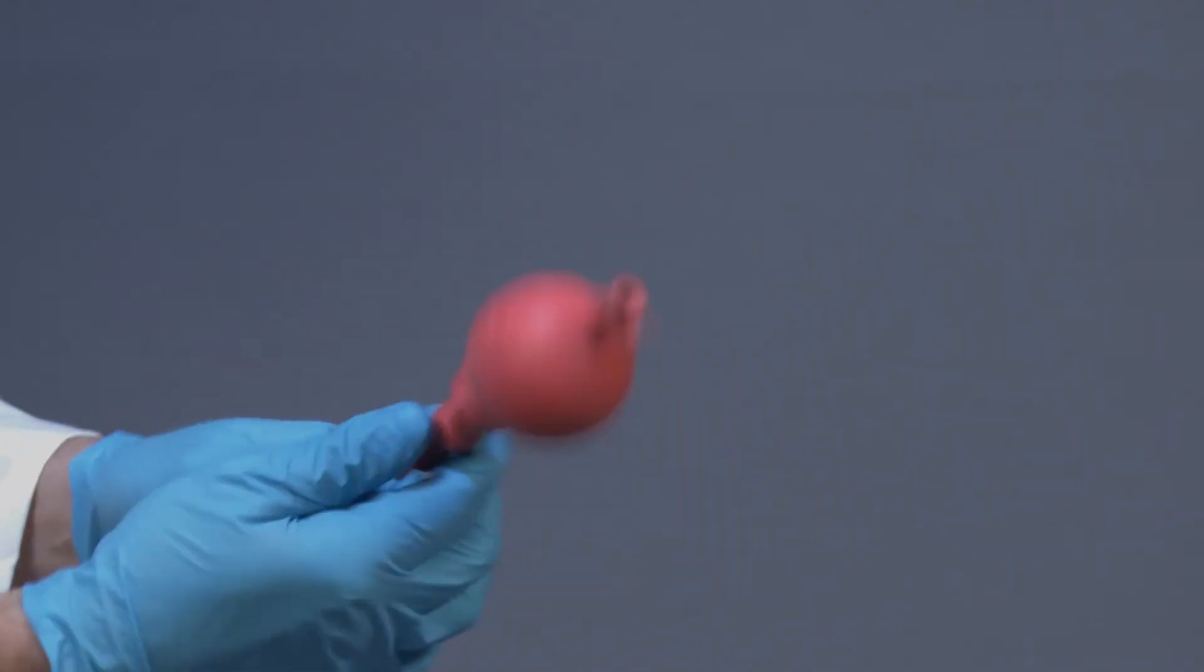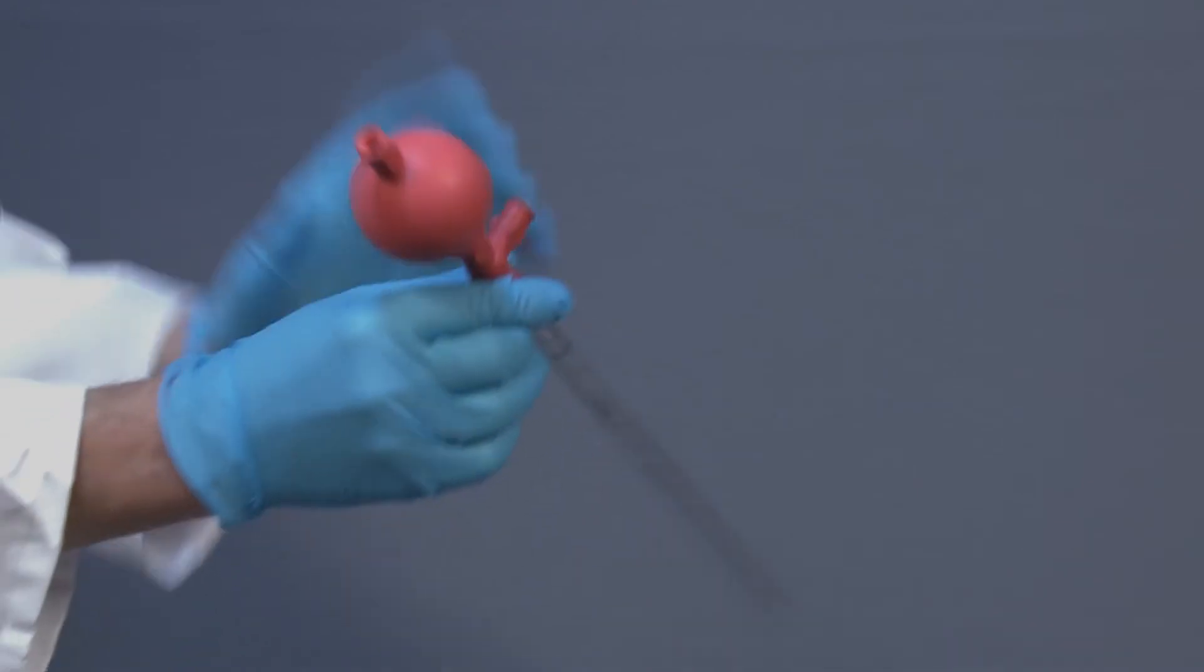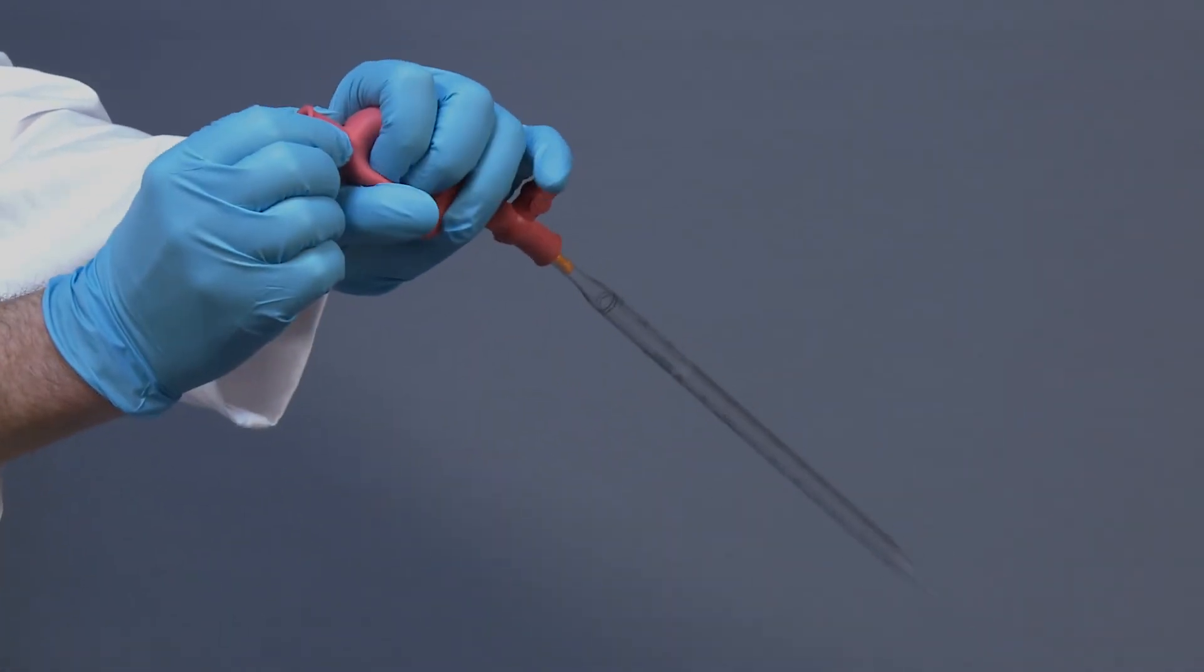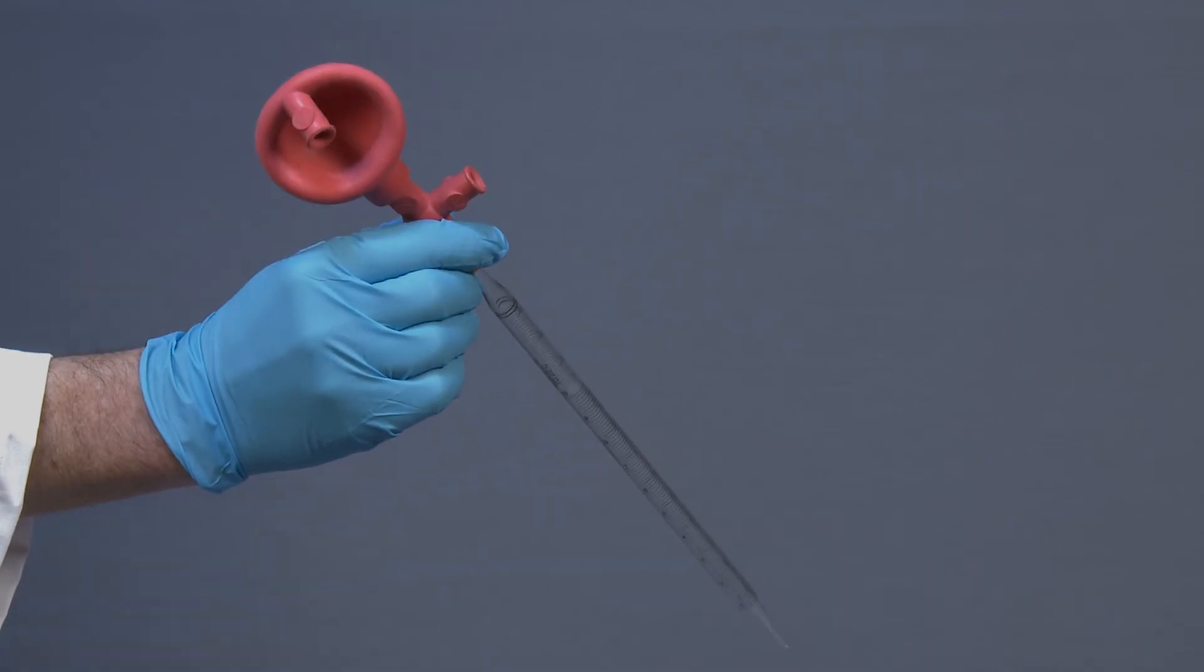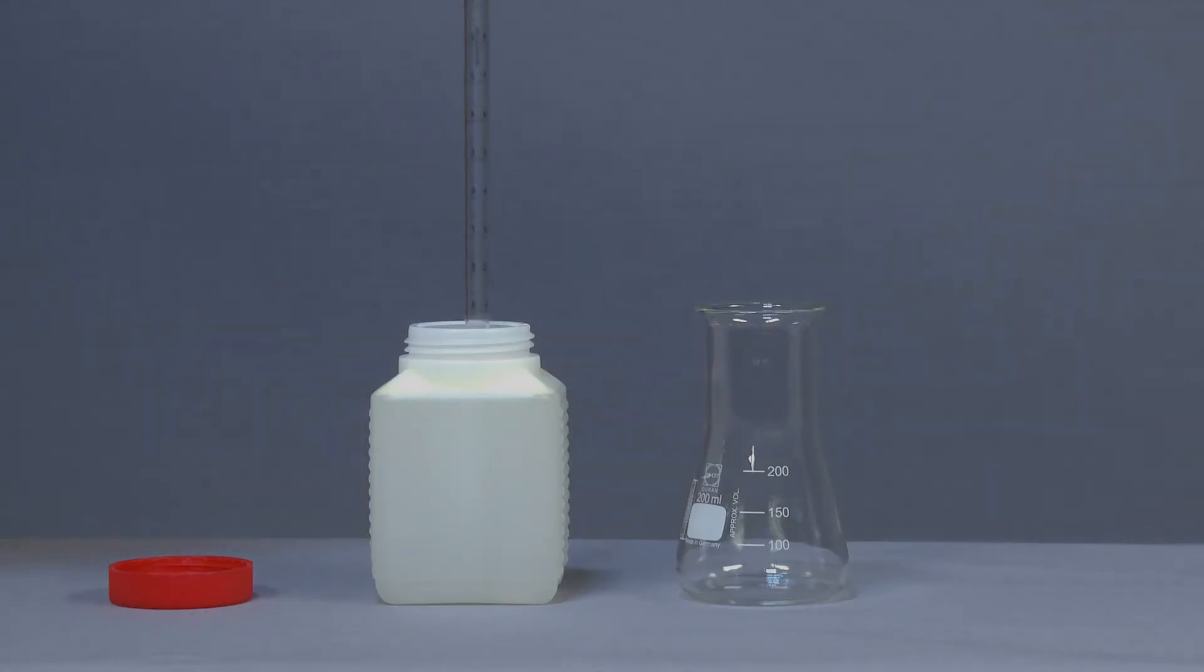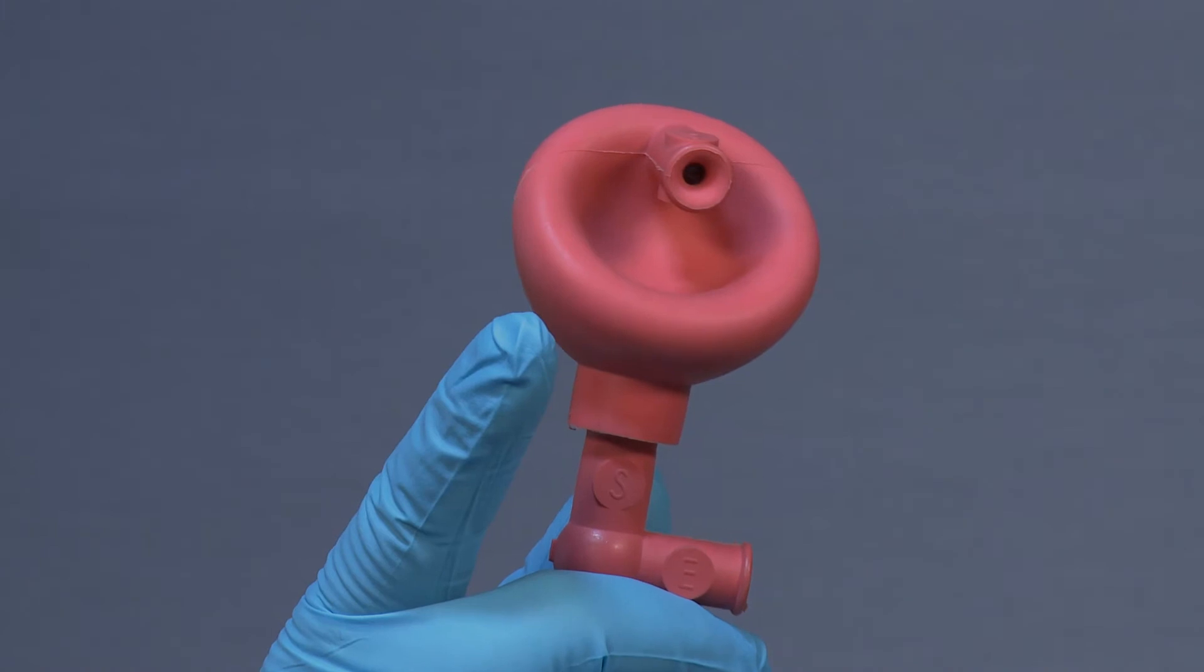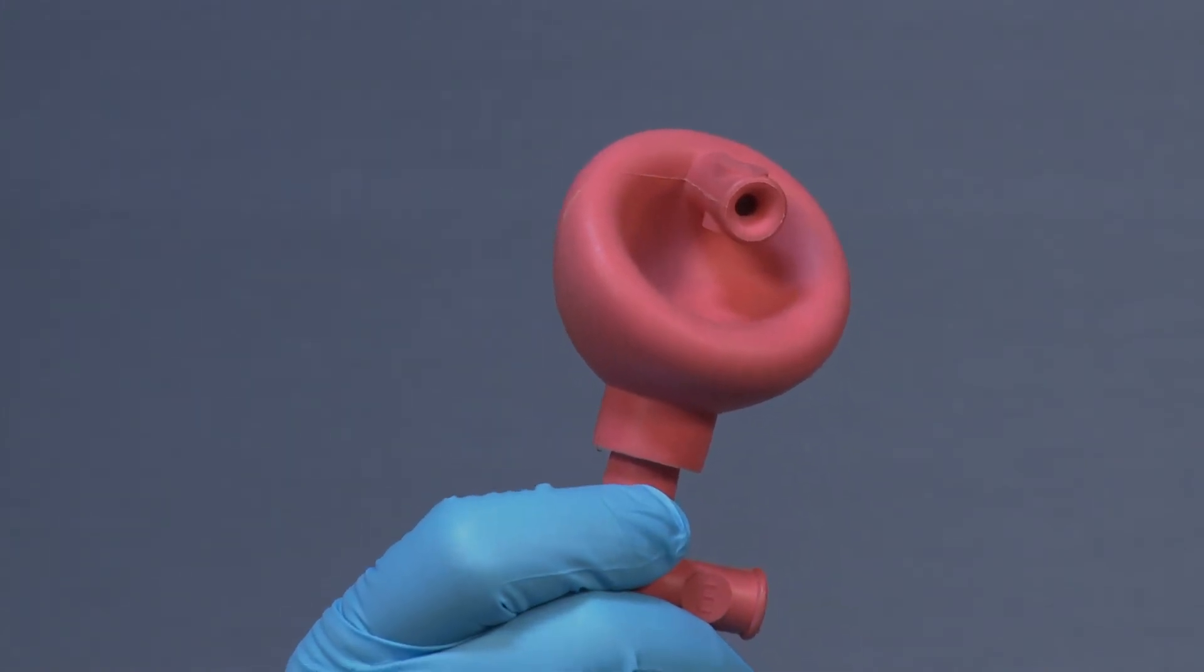Attach the Peleus ball to the pipette and press the upper valve A to release the air out of the ball by squeezing it. Take your sample solution and press the lower valve S to draw the liquid through the pipette.